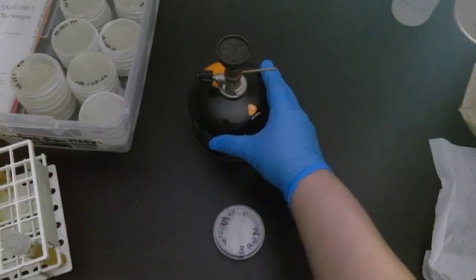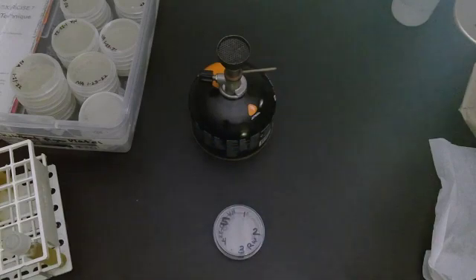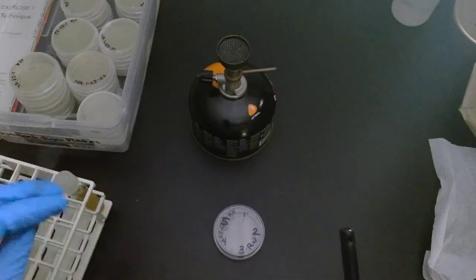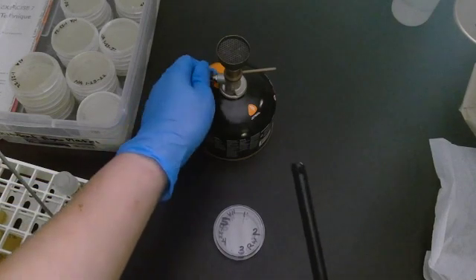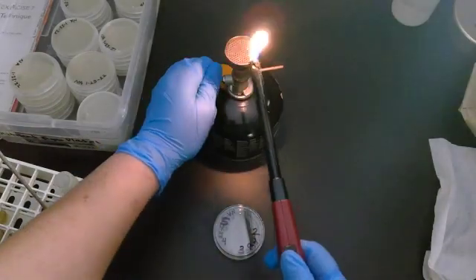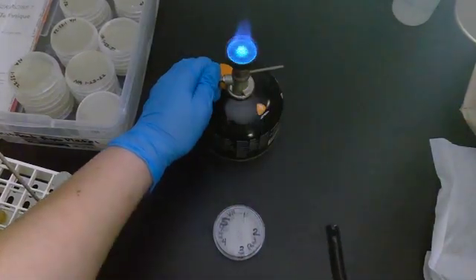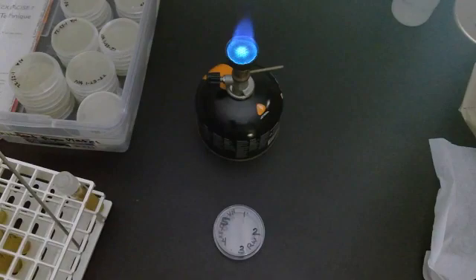One of the things I know I have to have is my Bunsen burner, because every time I start swiping, I'm going to have to heat and sterilize my inoculation loop. There's my flame.